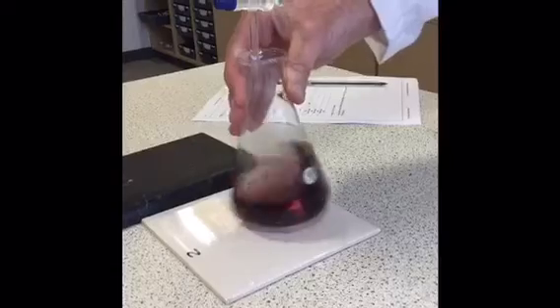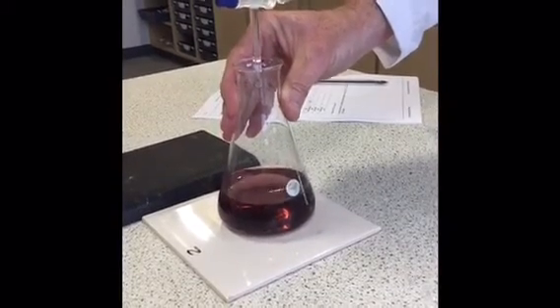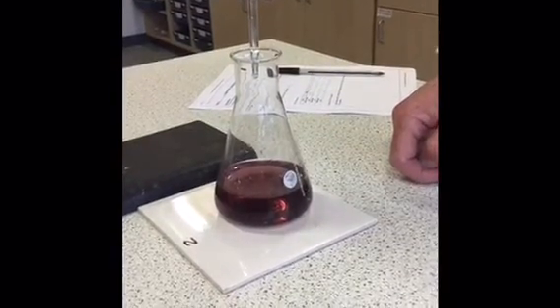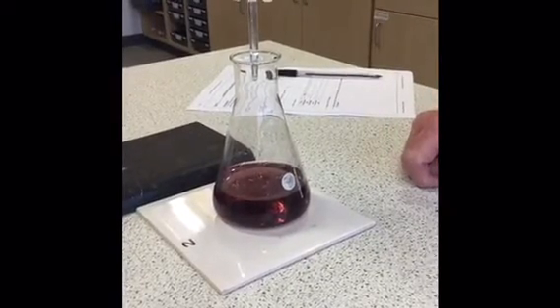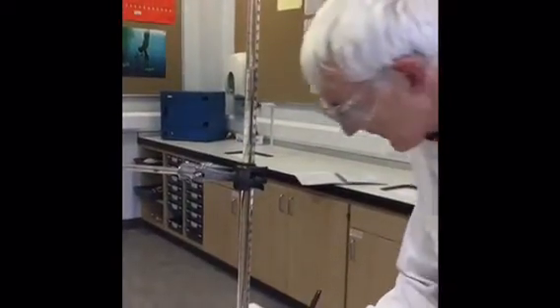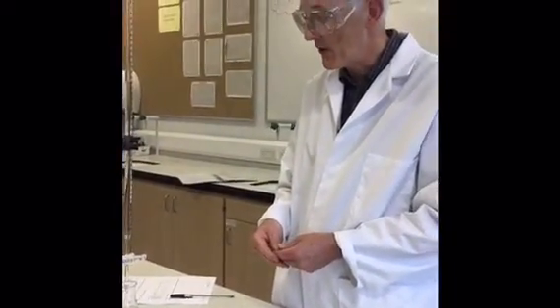And as you see, the solution has changed colour now from yellow to this reddish brown colour, and because of the rough titration I have probably overshot it slightly. So my final volume there is 20.6. So I've added 18.4 cubic centimetres. Okay. So I'll now proceed to do several accurate titrations until I get 2 which are within 0.1 of each other.